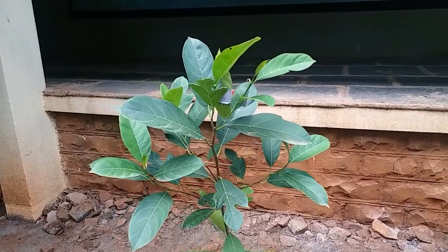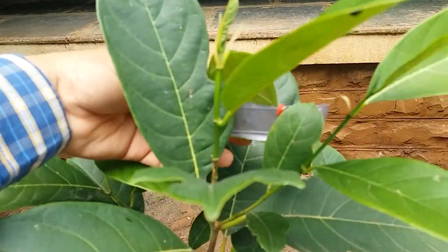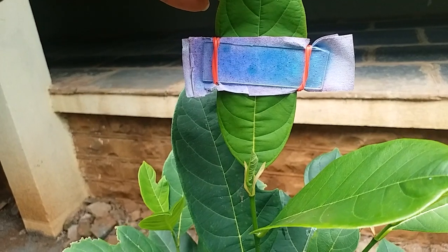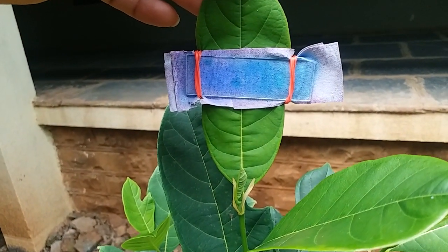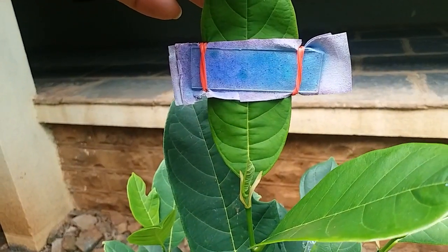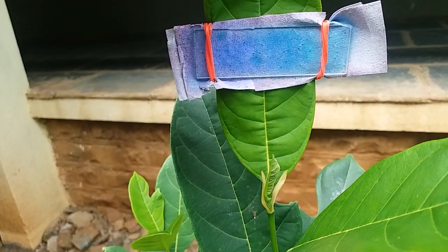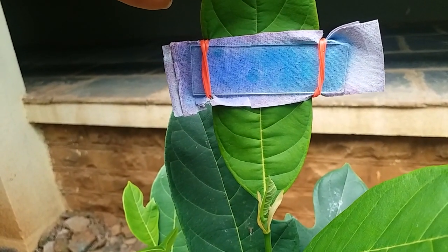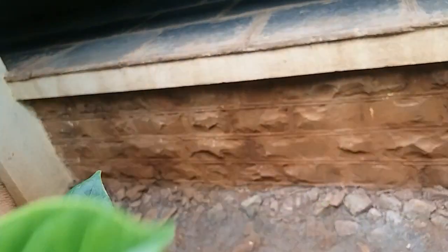About 15 minutes are over now. Let us see what happened to the cobalt chloride paper. On the upper epidermis, the paper present outside the slide is decolorized — it is pink, possibly due to moisture in the atmosphere. But the paper covered by the slide remained blue, meaning the transpiration rate is comparatively less or negligible on the upper epidermis.